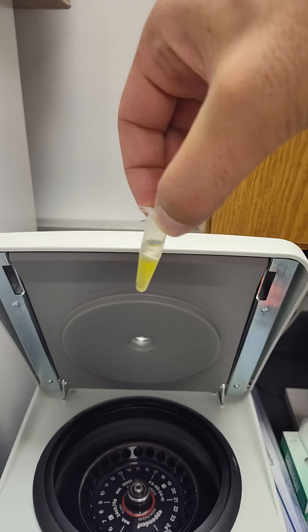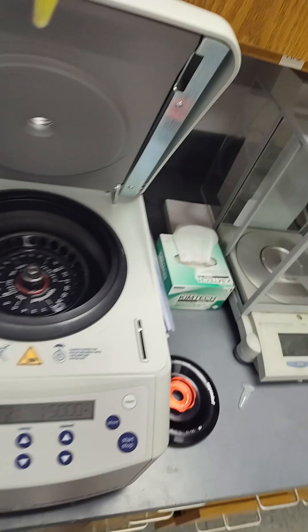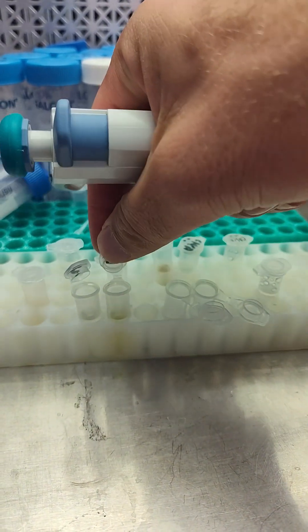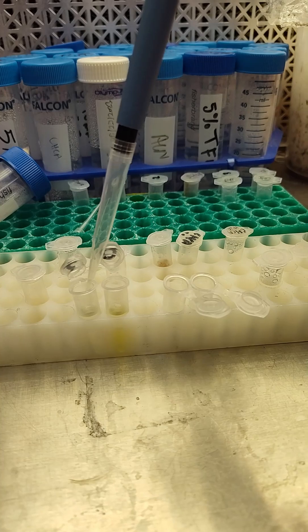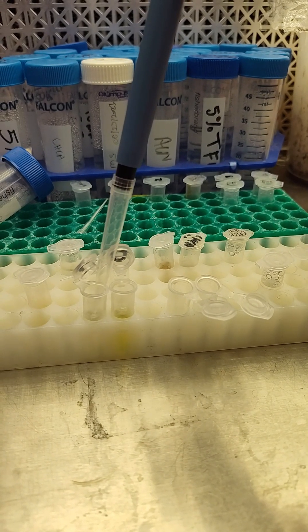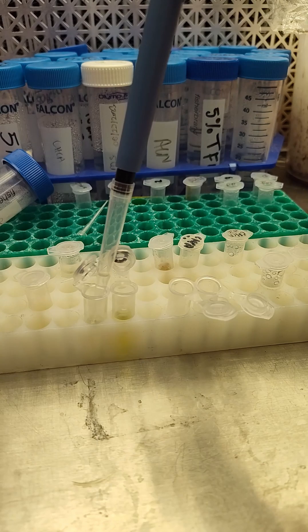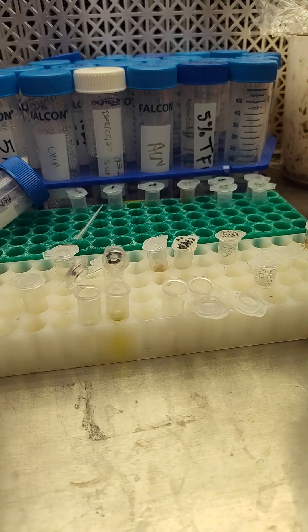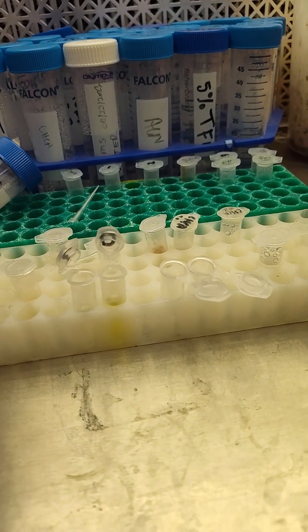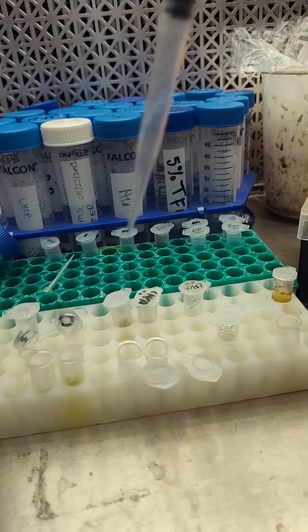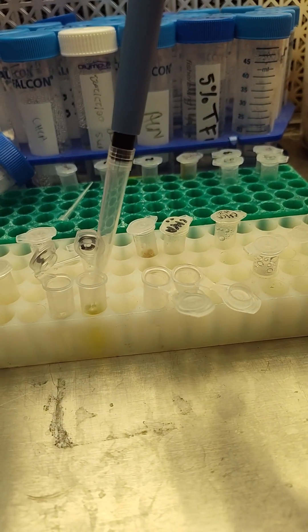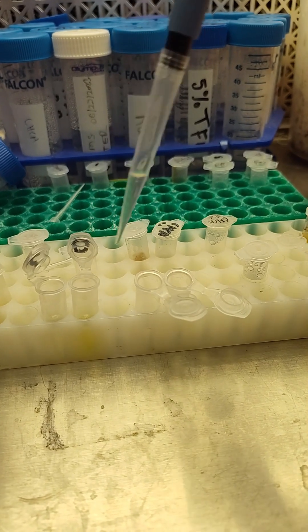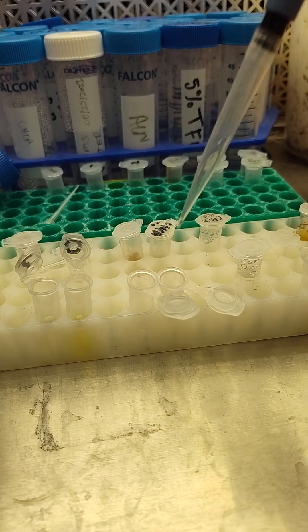So again, we're not really going to be looking at the oil. We're going to be looking at all the other stuff in the oil. We have to do this carefully. Open the tubes carefully. And then we're going to pull up very carefully from the top so we don't risk getting anything that's floating. There is 300 of the canola fraction. I think we did a really good job on that.